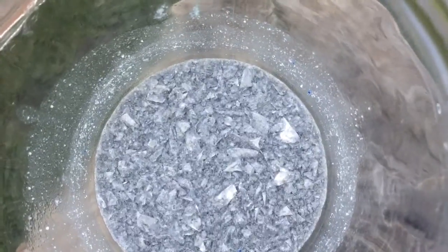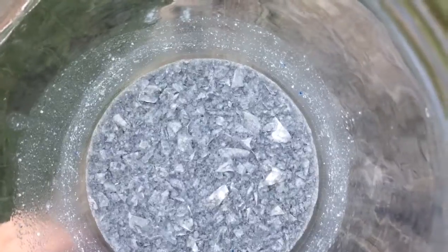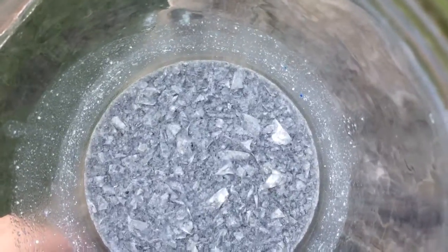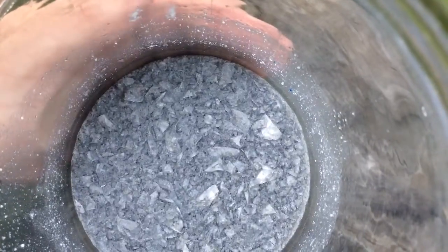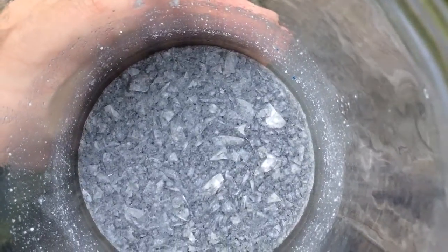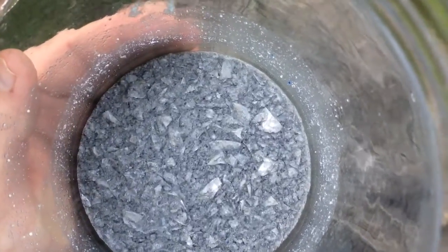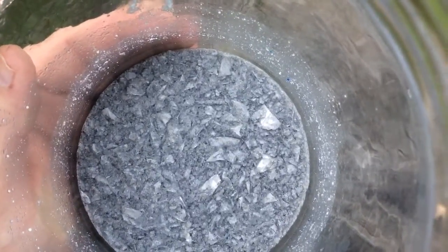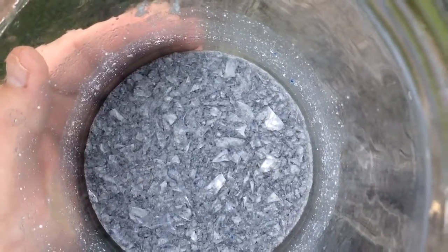So you can see here that our aluminum has turned into a bit of a slurry now, and it looks a bit like paper mache. And what's happened is the acid that we created using our powder and water has broken down and decomposed the aluminum. Now all those little bubbles, that's hydrogen gas escaping from the chemical reaction taking place.